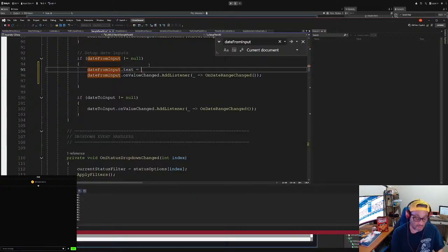Text equals date, date and time. Not date. Now, I believe now, right? No. Date, time. Let me look that up. Sorry, folks. Let me look up that. What is it? Okay, C sharp date time format. Date time. Oh, okay.